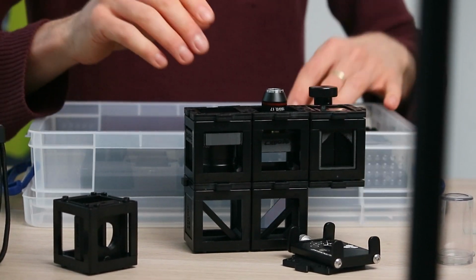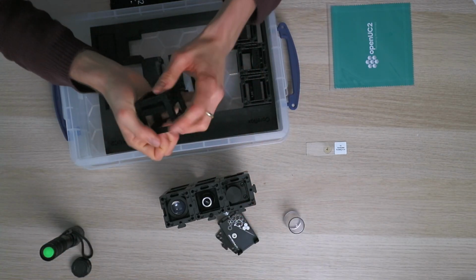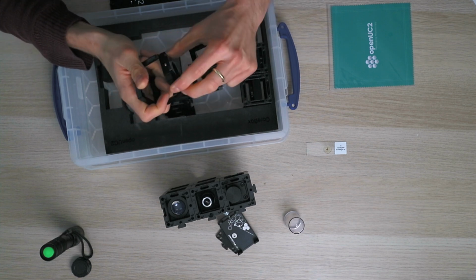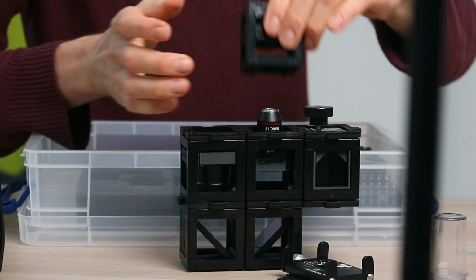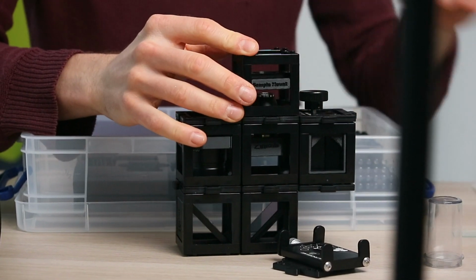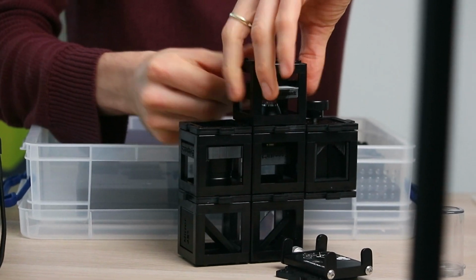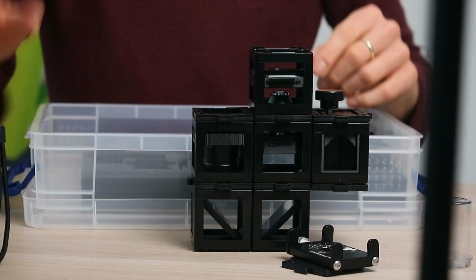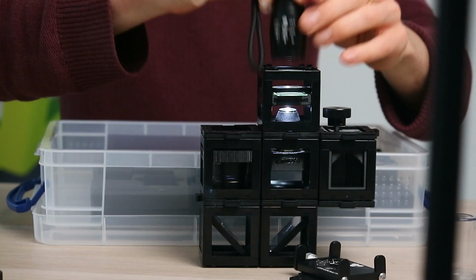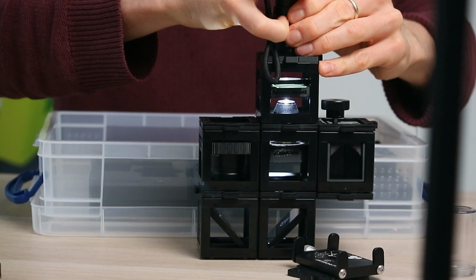In order to do that, we have to have some more components and also, of course, a part that holds our sample. In that case, we slide it in here and can mount it just like this here, take our sample, and then if you just take your eye and have a look here, you could already see something. Light is coming from above, but we take artificial light and then take this part that holds the light here.